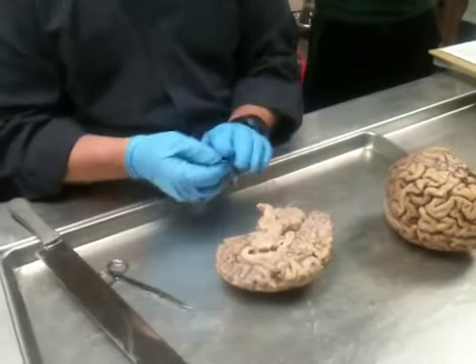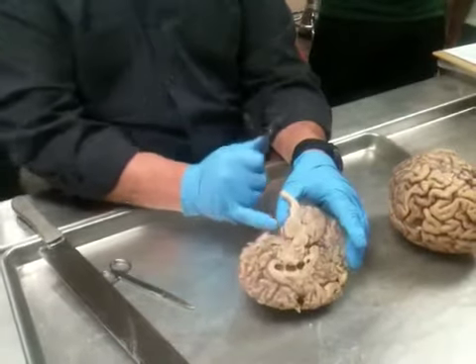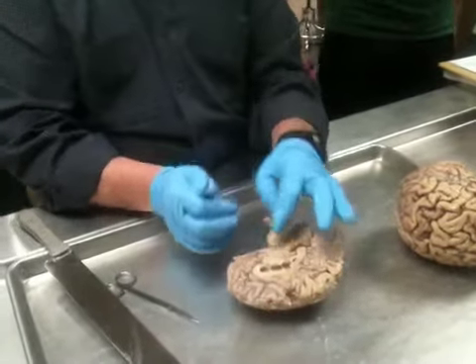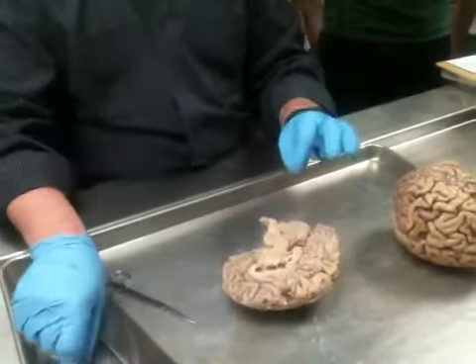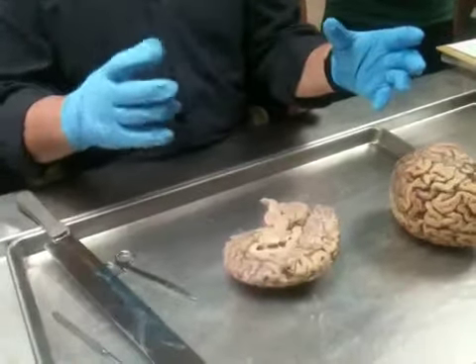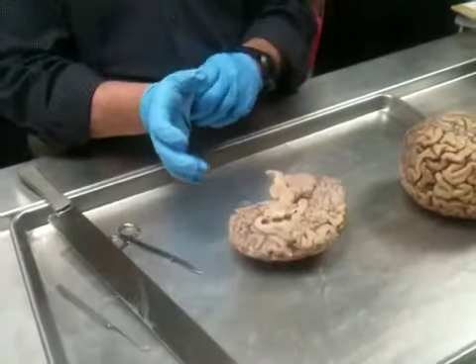When we look at it in a coronal section, it's going to ultimately cut through the rostral part of the temporal lobe, which will be the amygdala. So that interventricular foramen is really our landmark that gives us the best access to see all the different structures that we've talked about in class, okay?